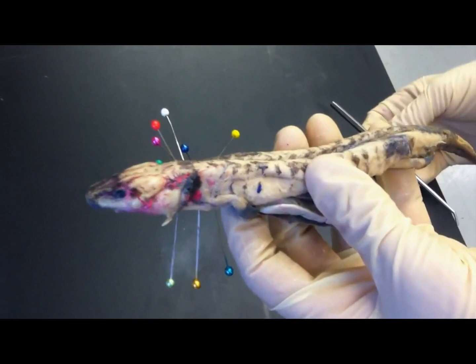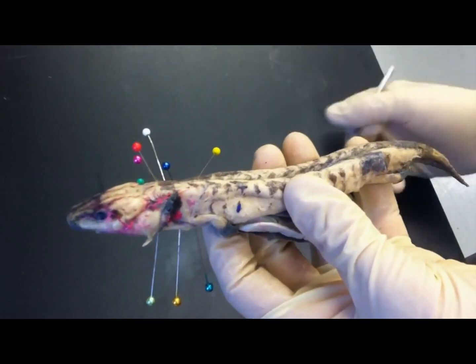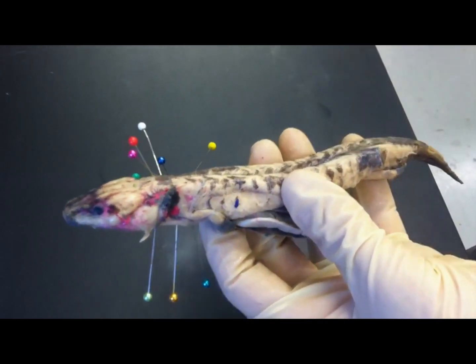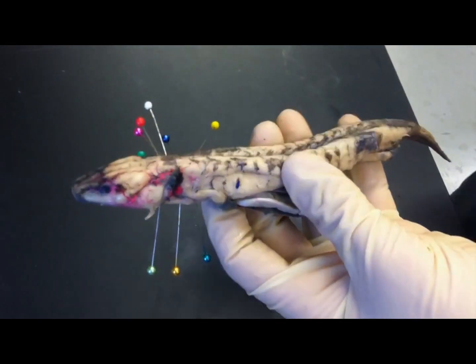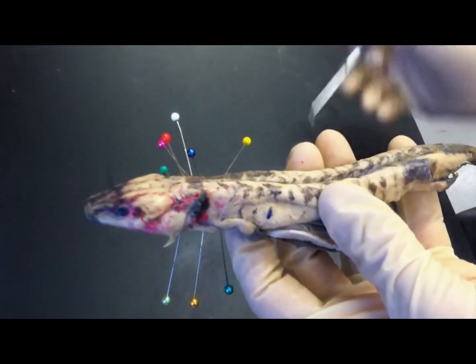We have the Necturus, or the Mud Puppy, here. It's already been skinned. We're going to go through the muscles in the order that they are on the terms list.